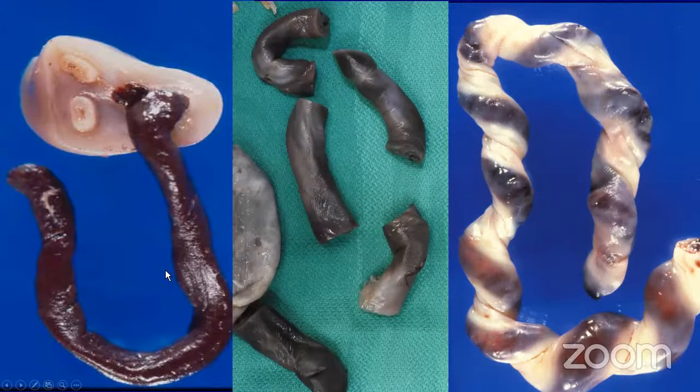In terms of standard placental slides, most institutions, including ours, put in extra disc slides with demises. There was a paper that showed the standard number — three central paracentral full-thickness disc sections — should be sufficient.